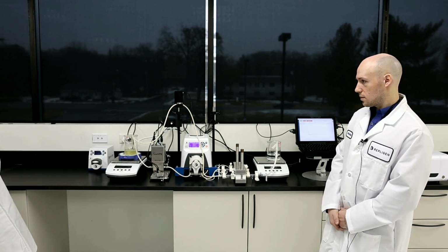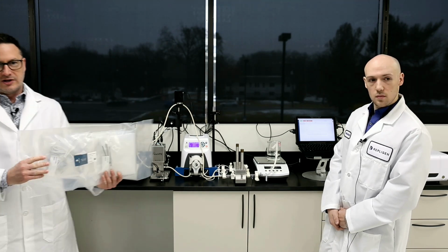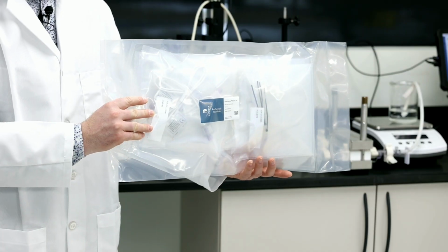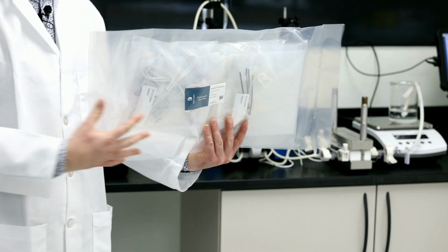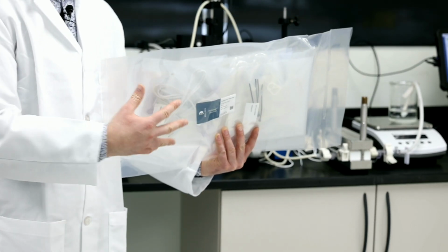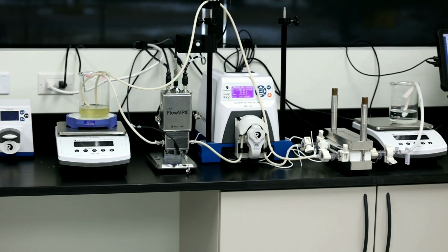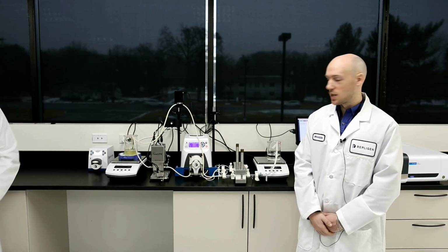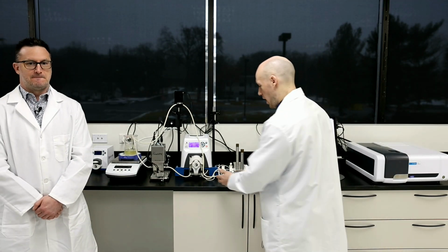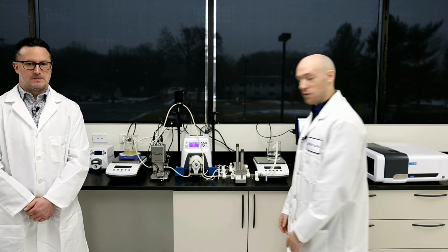And then lastly, what I can also show you is a quick depiction of what our ProConnect's flow paths kind of look like. Here's ones that come bagged up, but basically all of the separate components are all contained within the singular packet. You just pull them out, assemble your flow kit, and you're ready to go. Go ahead, Brandon. Yep, and that's if you're going to want to use a more sterilized process. However, since again we're non-GMP and just using BSA for this test run, I just cut the tubing myself, and again, nothing I'm using here is very sterile.